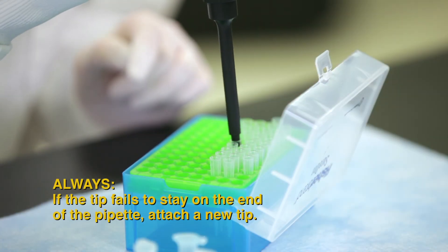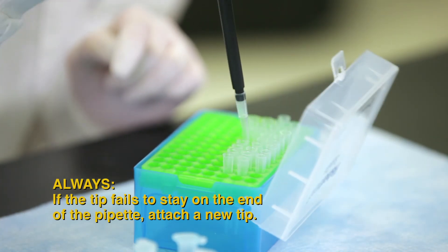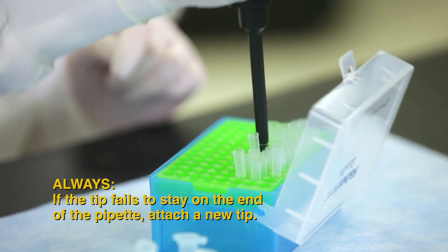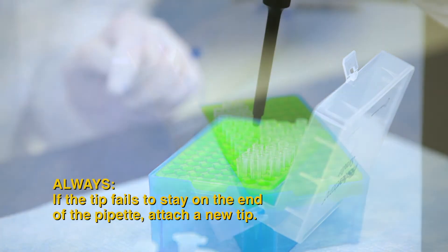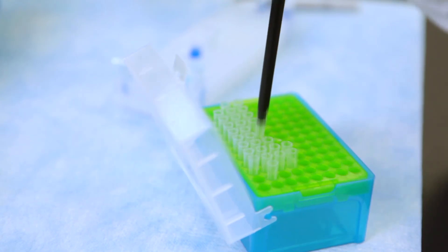Sometimes you may struggle to attach a tip to a pipette. If so, do not repeatedly jam the pipette into the tip. This can damage the pipette, and if your tip doesn't stay on the end of the pipette, simply repeat the proper procedure with a new tip.